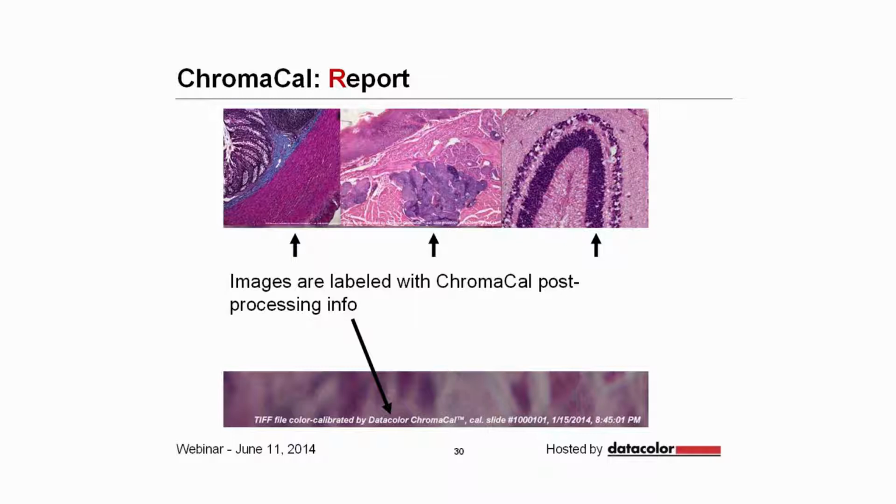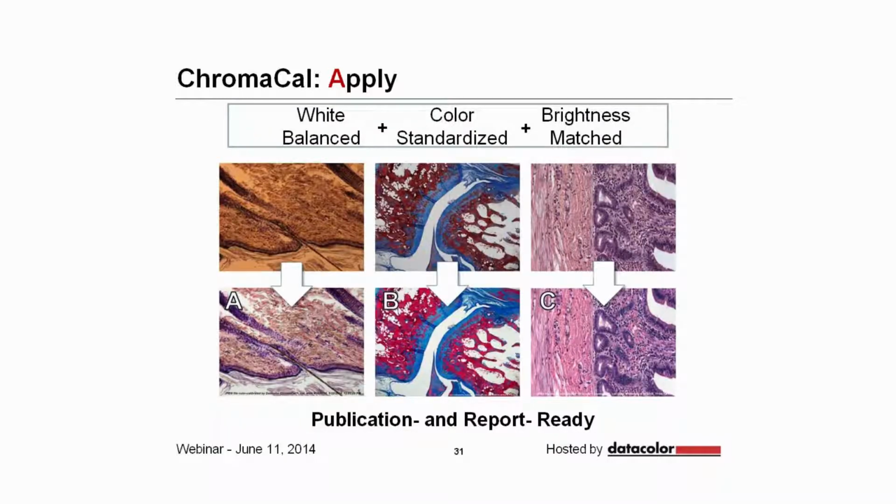And then finally, it applies some post-processing, all the time keeping the image linear. So not only does it white balance, as you can see in the first set of images to the left, but it also color standardizes and brightness matches. So in essence, what it does is it gets your image from its original state to publication and report ready.